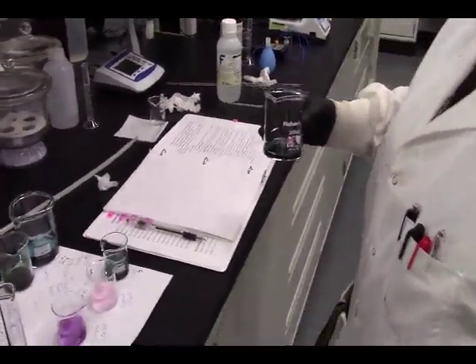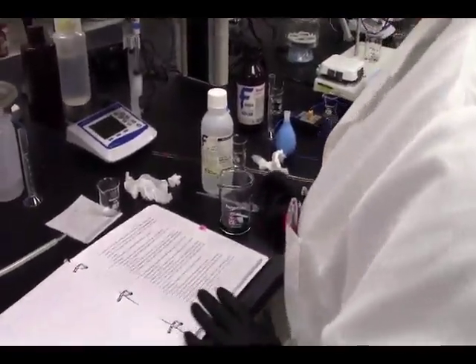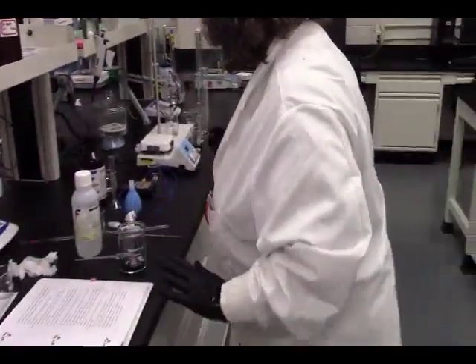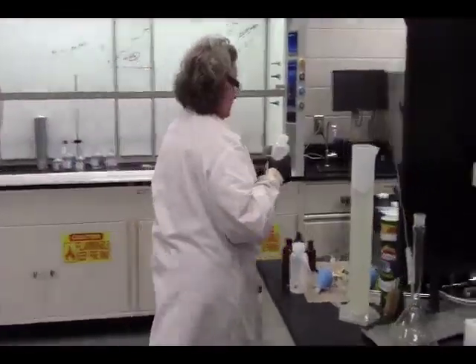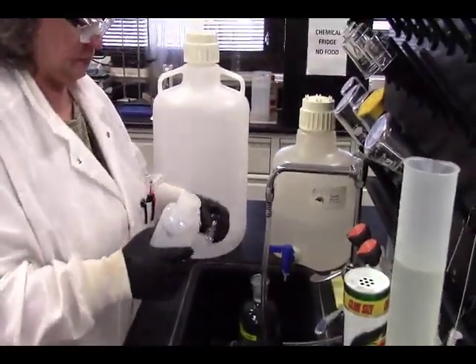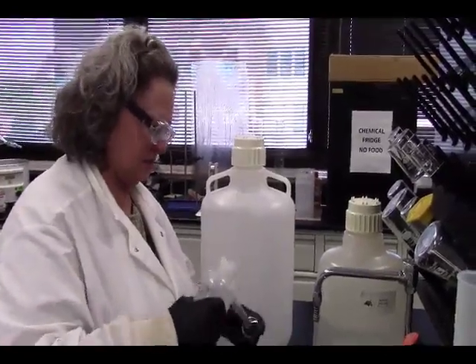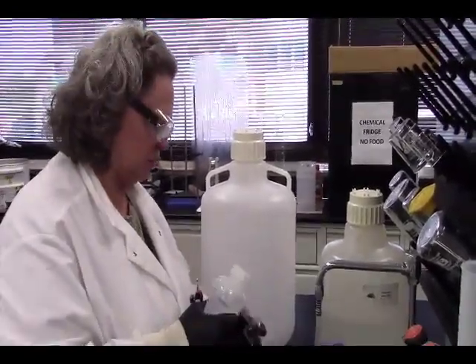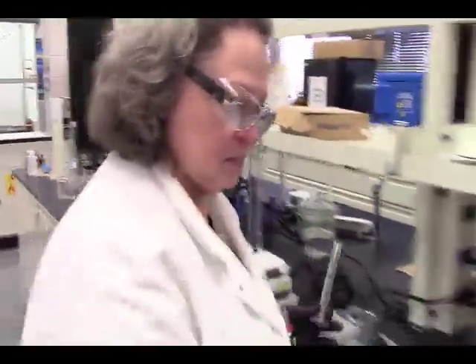So we're saving some of complex 5, and we're going to use this to make phenanthroline complex. All right, so we need 10 milliliters of this. We have used so much. We're running out of glassware here. Three rinses. Analytical chemistry, 3. Magic number. 3 rinses.